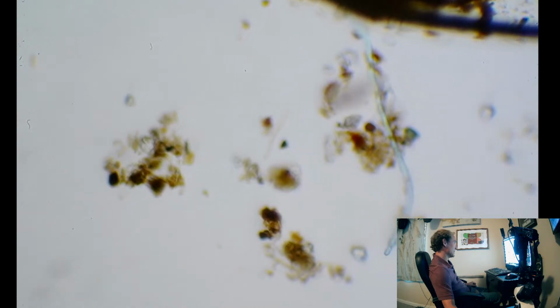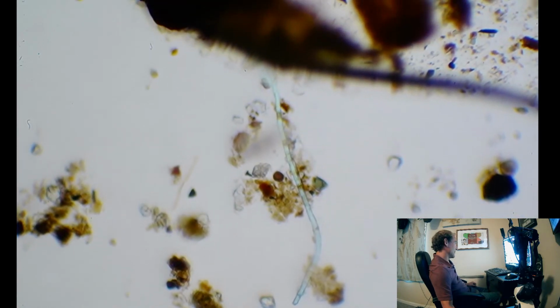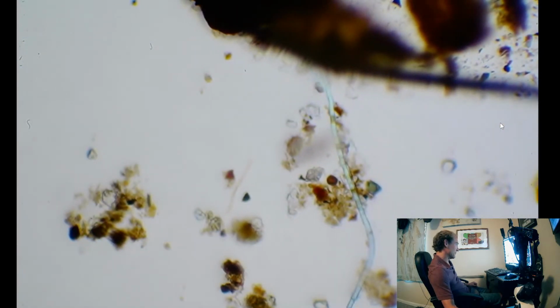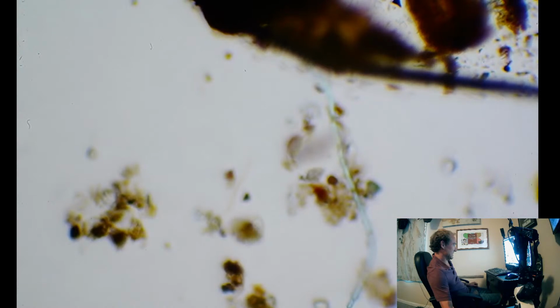No cause for concern, but we're probably going to have to zoom in. Oh, there's a bubble. We got anything else up here? That's interesting. I almost thought that was microplastic here. This is inside of a bubble on the slide. The water's over here. That's just a piece of mineral floating around. But we could see hyphae here and here. So that's an odd looking fungal strand, just how it's blue like that. Huh.